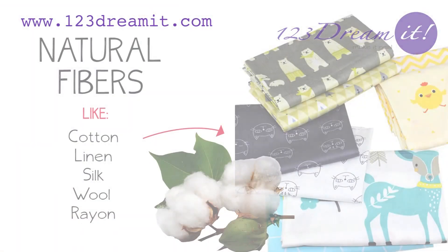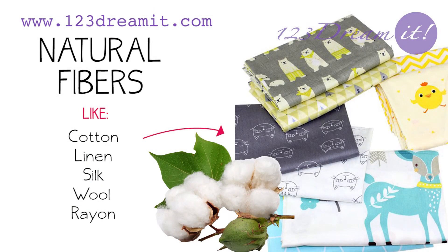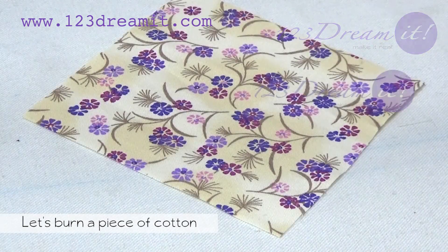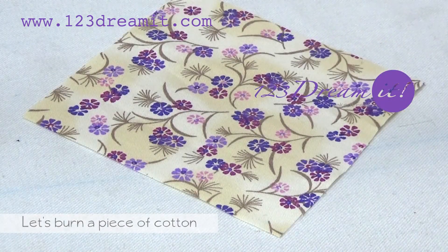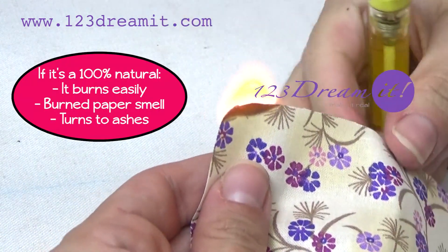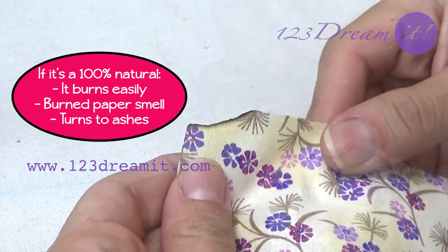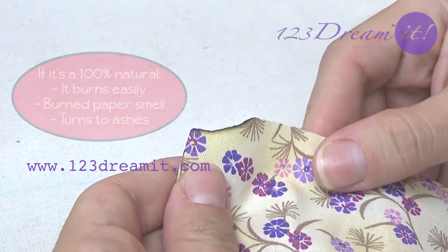Here we show you some examples of natural fibers. It can be cotton, linen, silk, wool or rayon. We're starting with a piece of cotton. Burn it, and if it burns quickly, it means it's 100% natural. It has a smell like burnt paper and turns into ashes.